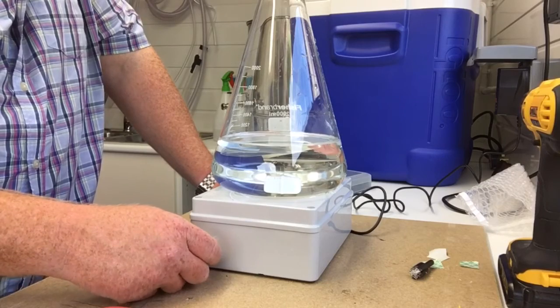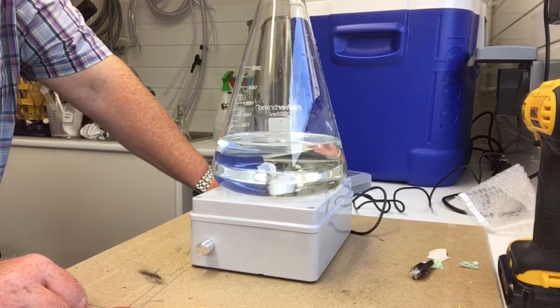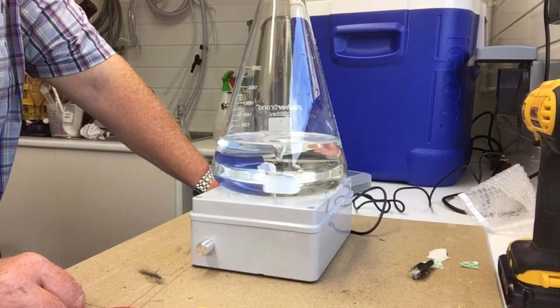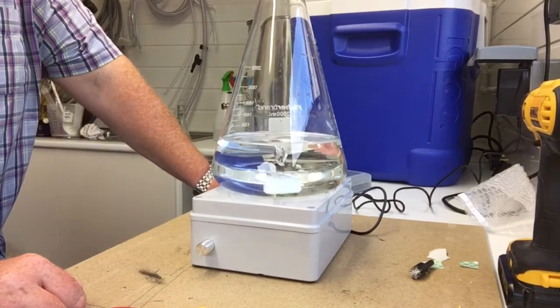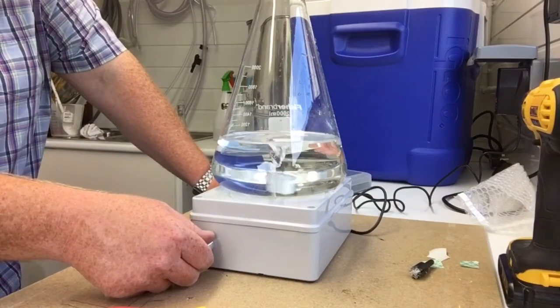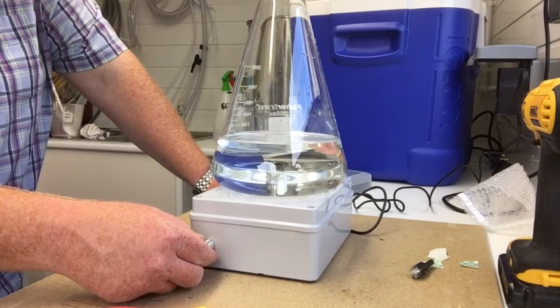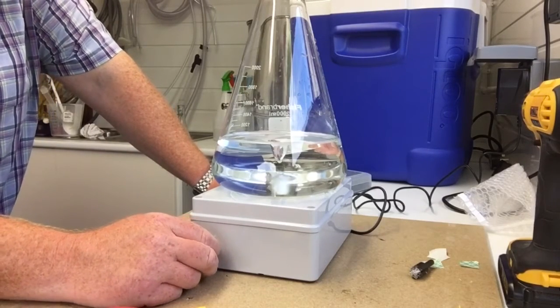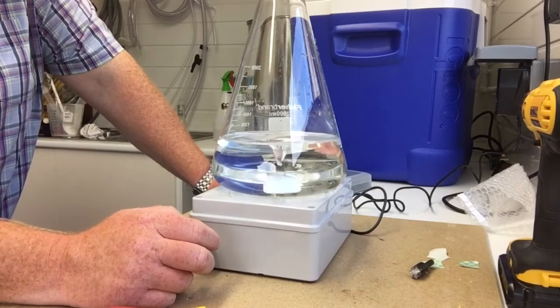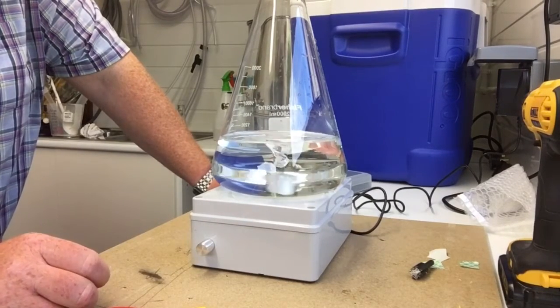Okay, here goes nothing. Sorted. We're working. Happy days. Not too difficult, is it? It's surprisingly quiet. In fact, I can hardly hear anything. Well, run out.